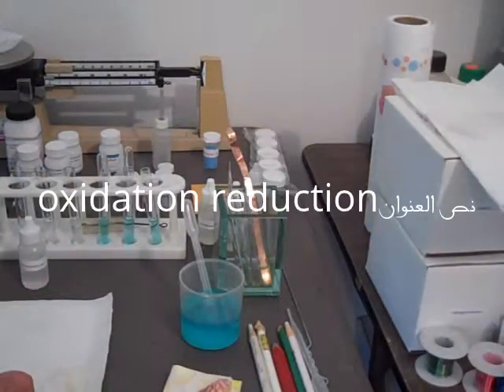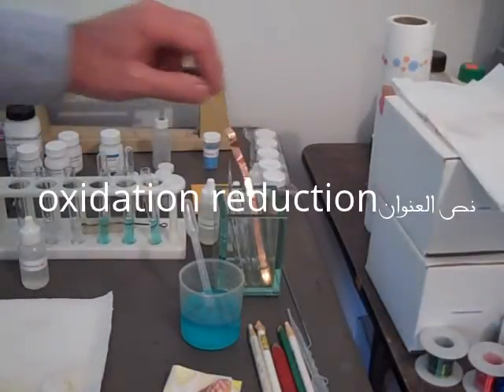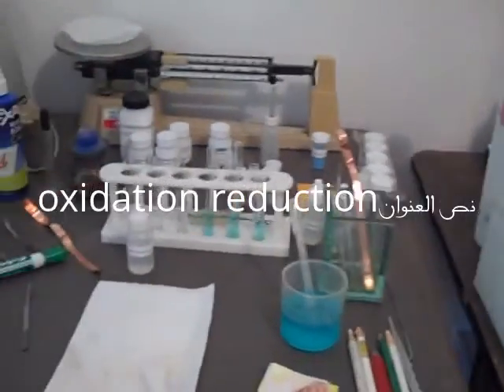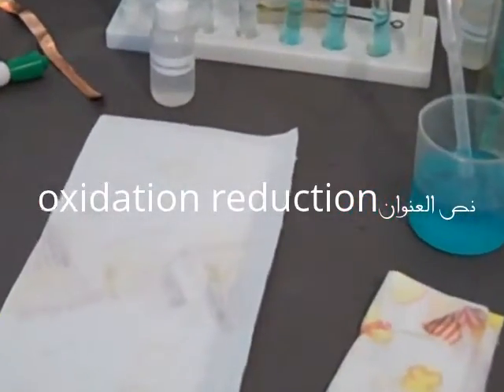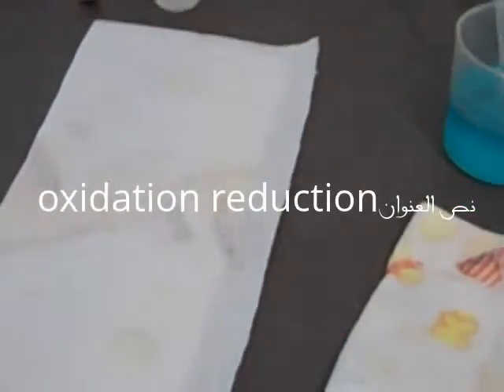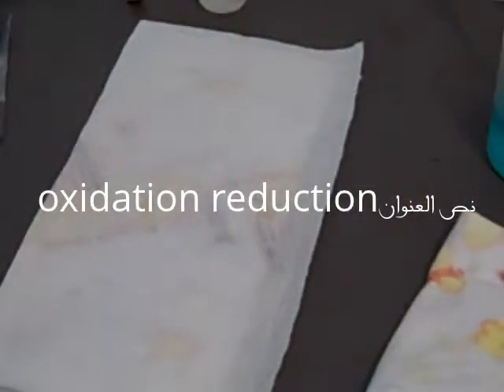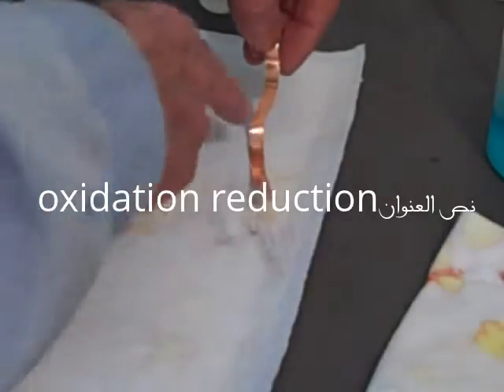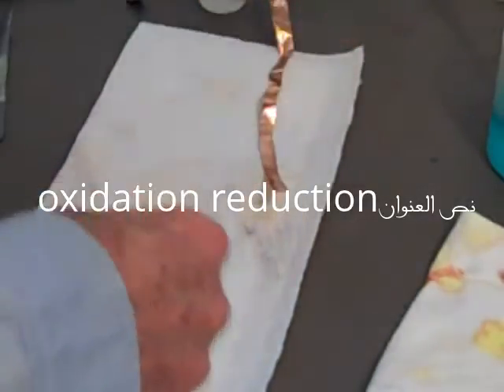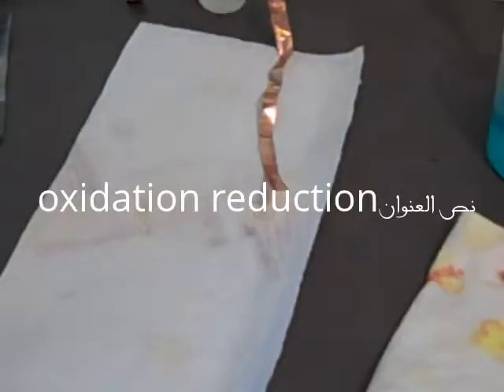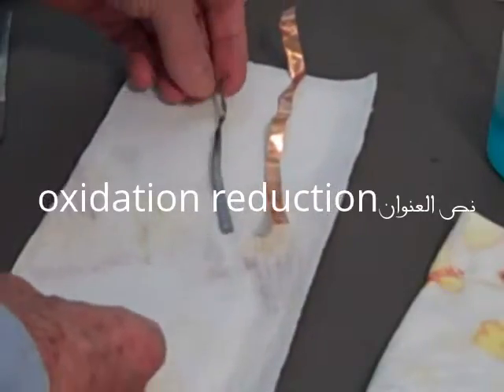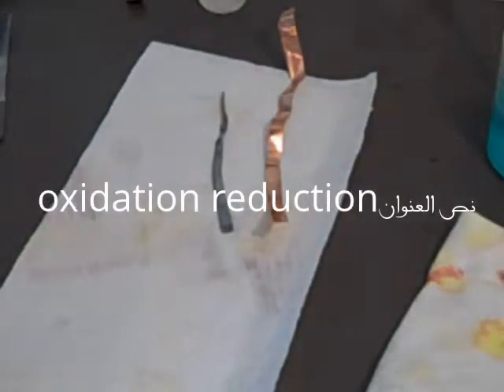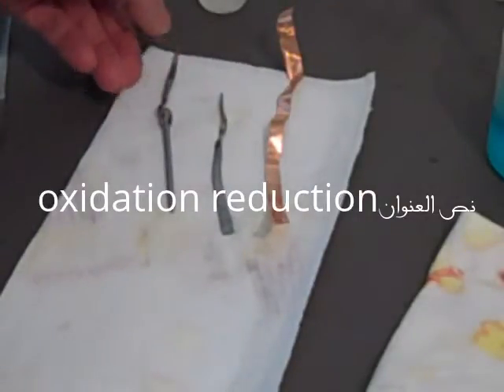I'm going to sample galvanized now, and we'll look at them here. I want a close-up. Copper, again, no reaction—we expected that. The lead—this is in the zinc solution this time—no reaction. And the zinc should have had no reaction, but you know, where's the—this is the untreated nail.